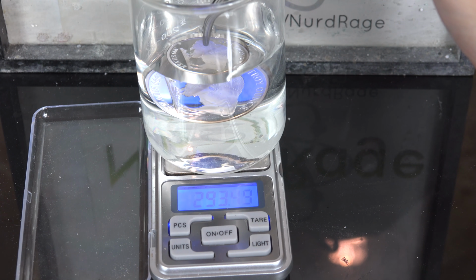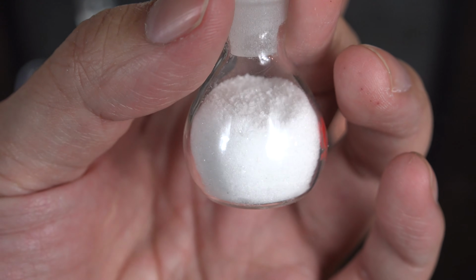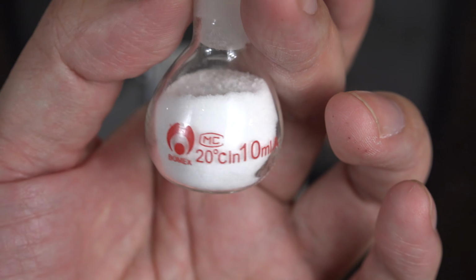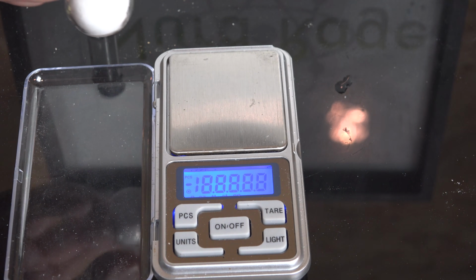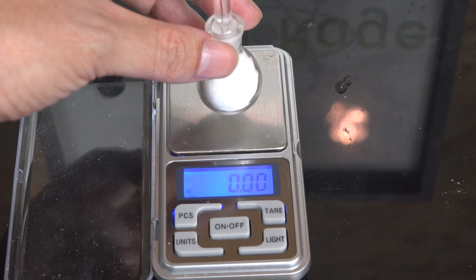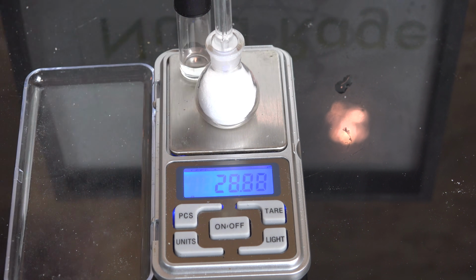Now, this method is great for a monolithic solid. But what about a powder? The majority of solids we chemists work with are powders. You can't simply take the bulk volume to get bulk density, as the gaps and spaces between the grains will throw it off. And since the grains or crystals can have different sizes and shapes, there isn't an accurate correction factor we can use. So we need to somehow accurately measure the volume. We can do that with a pycnometer.